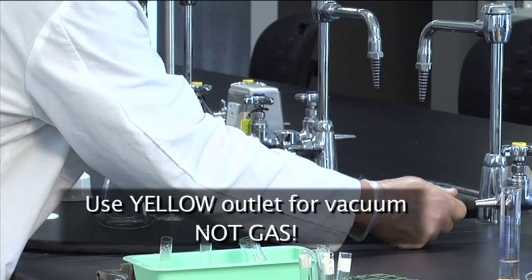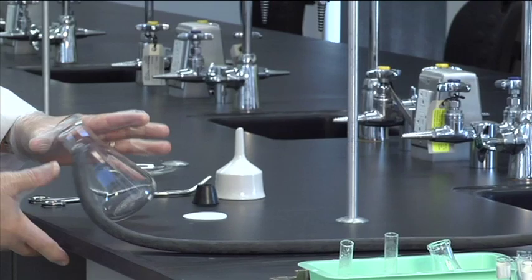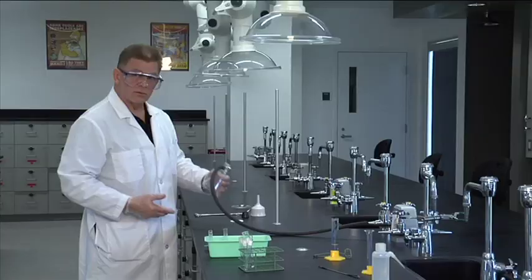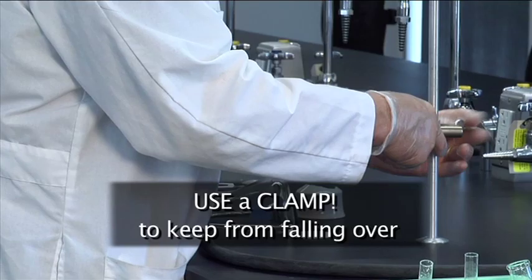Now other end on the hose connection. And now we leave this unclamped and you see what happens. See what this is going to do if I don't have that clamp. This is going all down the front of me. And I know you might pay money to see that but that is not the intent.